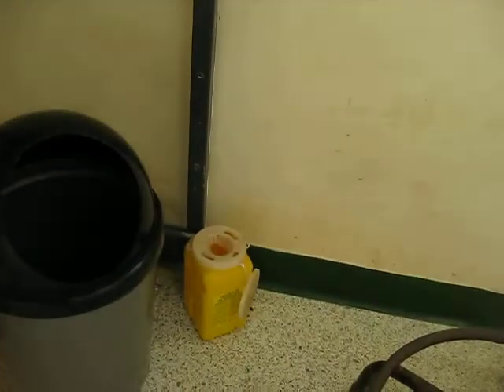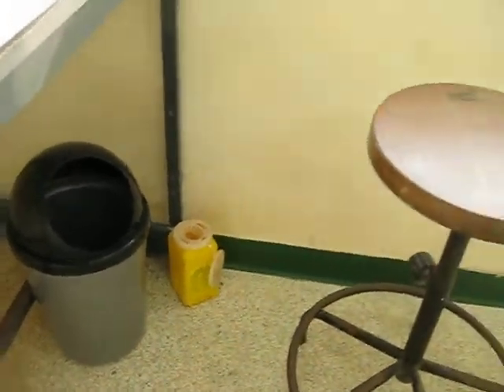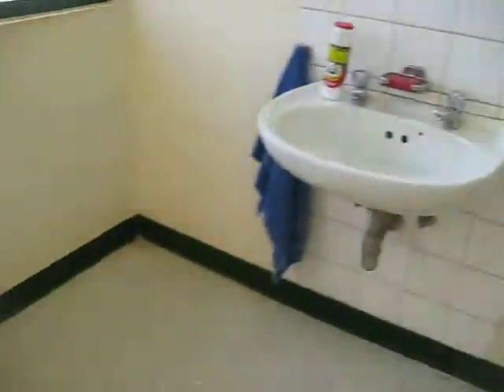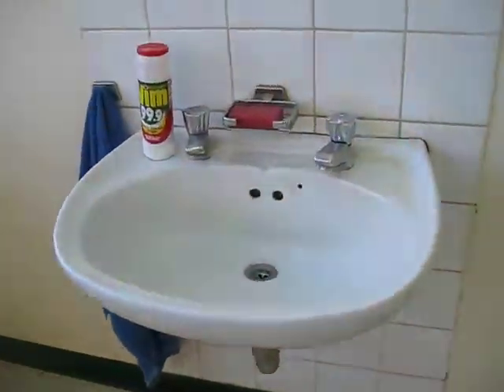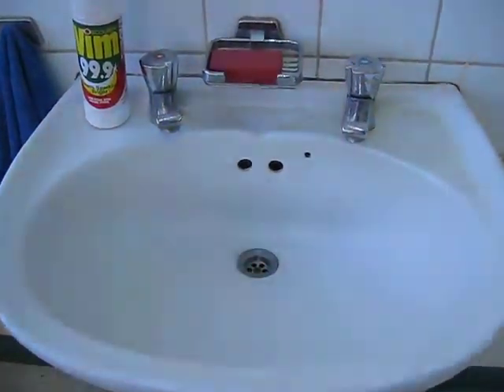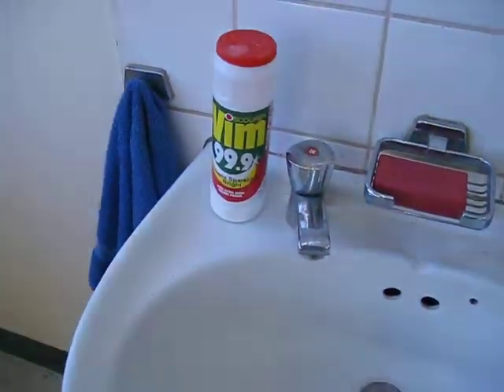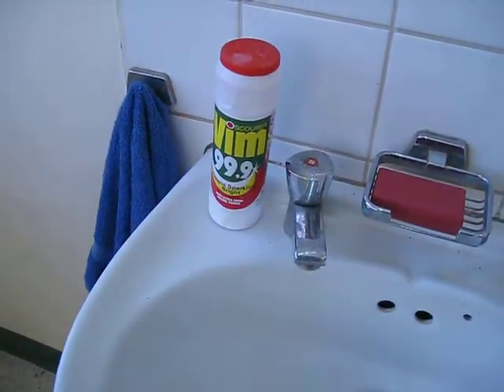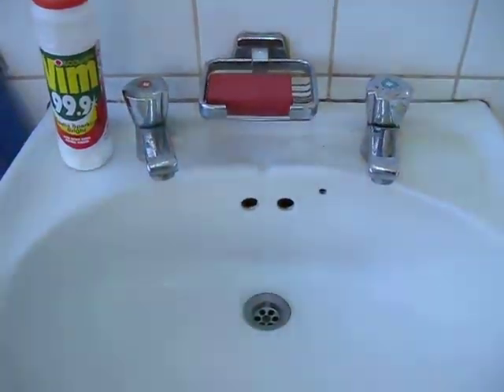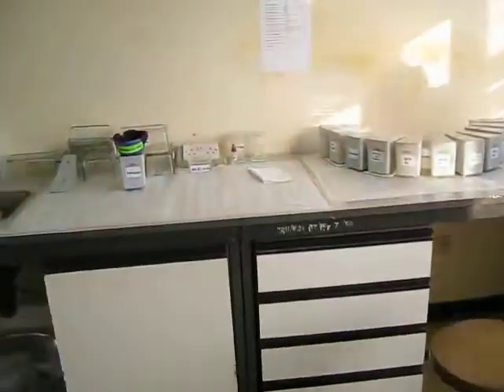You have a sharps container where you can dispose of all your needles, you have stools, and then you have another sink where you can wash your hands after every procedure or after you have finished for the day, with a towel and gloves available.